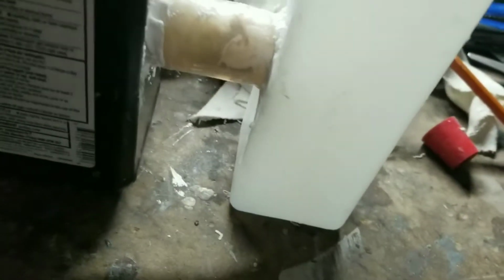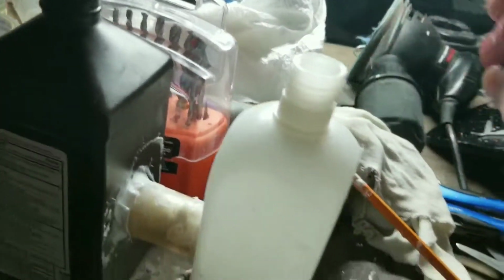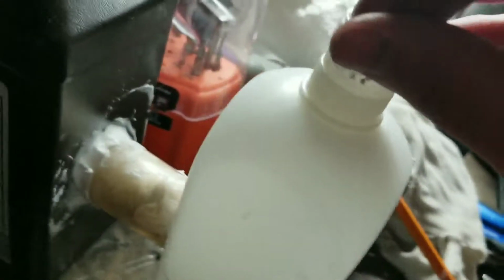Okay, so as you can see, I have made the bridge. And although my caulking job is a little messy, it'll do. And it's relatively easy to remove this stuff after it dries, although it's difficult when it's still drying. So I'll just remove some of the mess after it dries. But while that's drying, I've got to build some tops for this. Nonetheless, let's get into it.